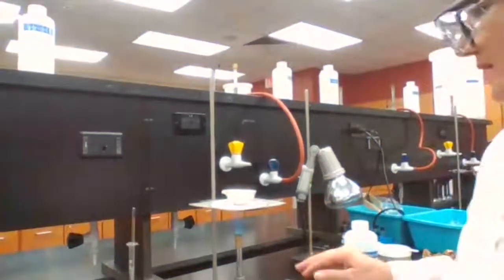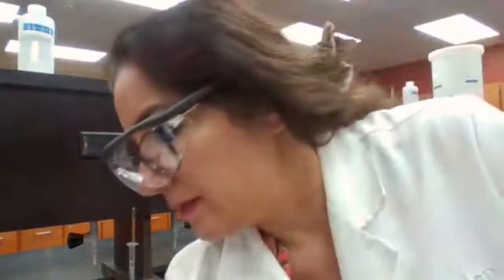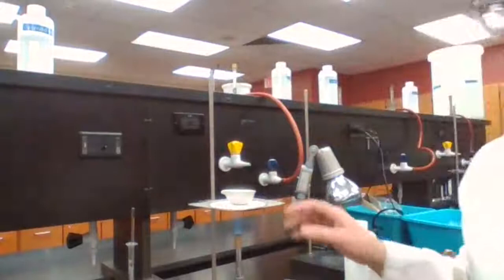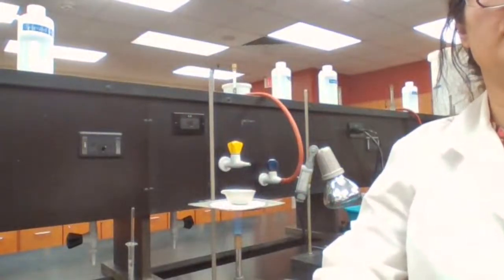Just gonna give it time, and at this point a low flame is better. It's gonna take maybe 2-3 minutes, and it will finish. Just gonna give it time.